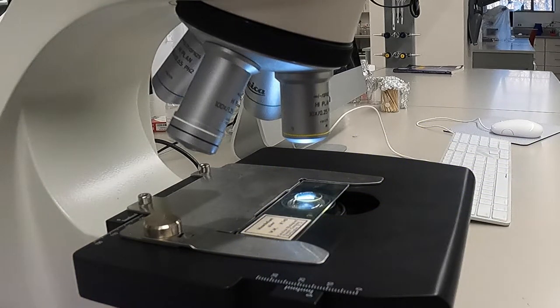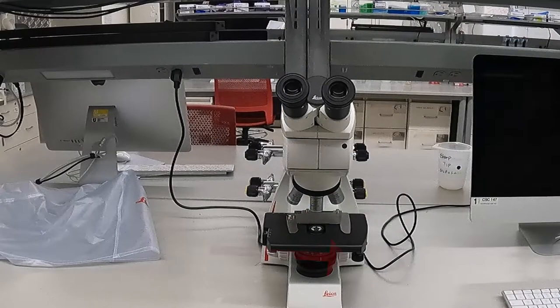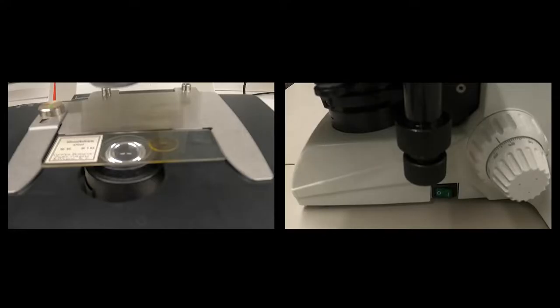On the stage, you will find a stage clip. This will keep your slide secure and is connected to the stage controls, which in turn can be used to make small positional adjustments to the slide.